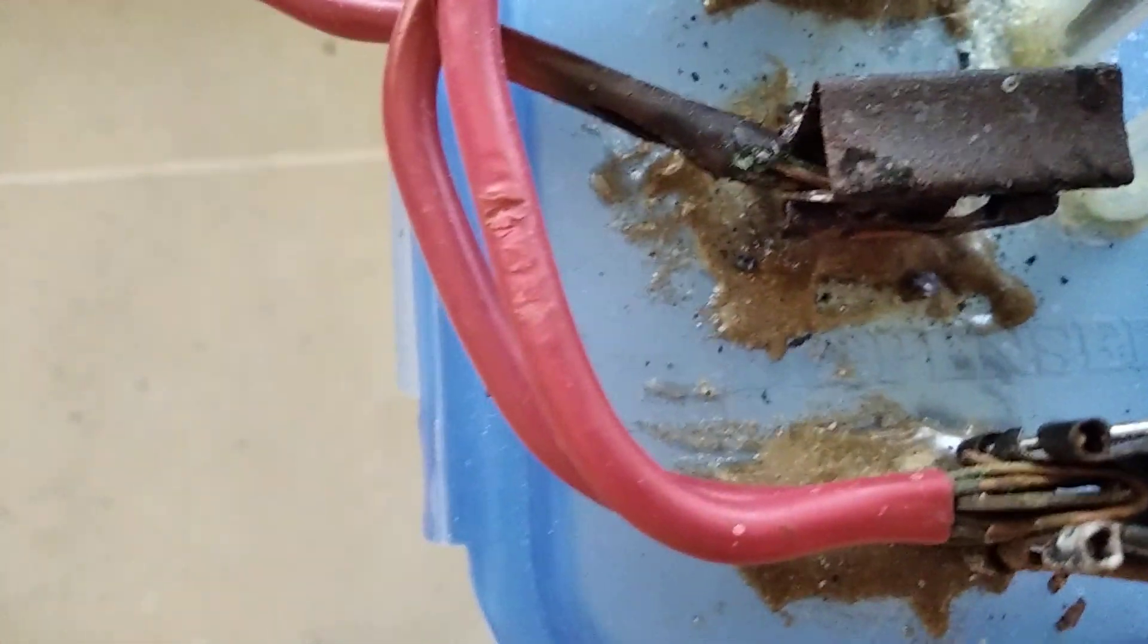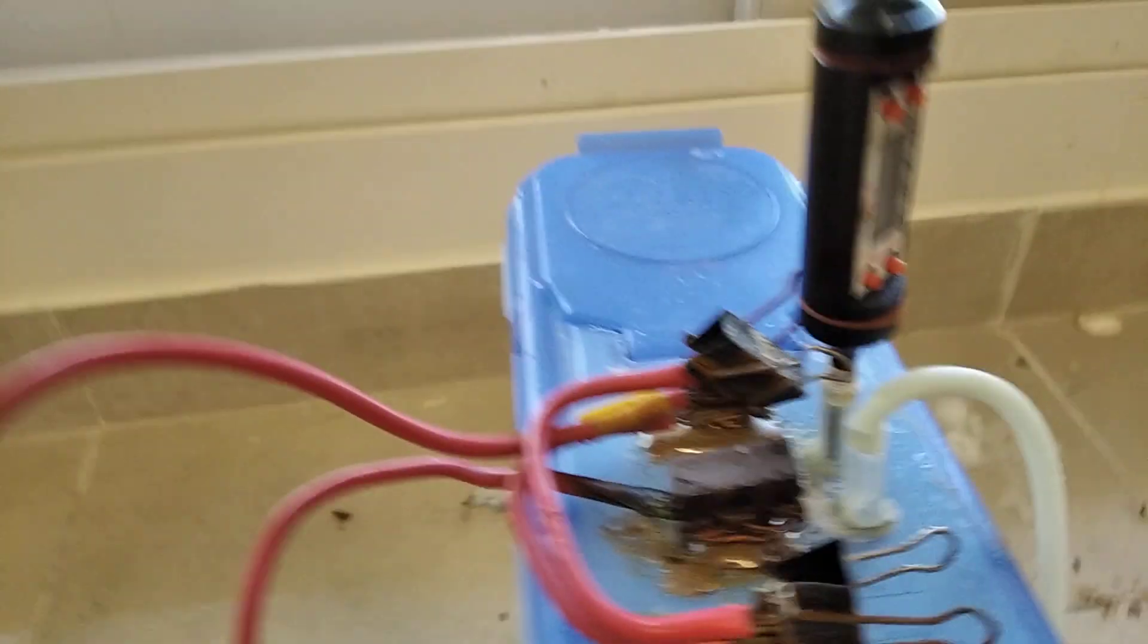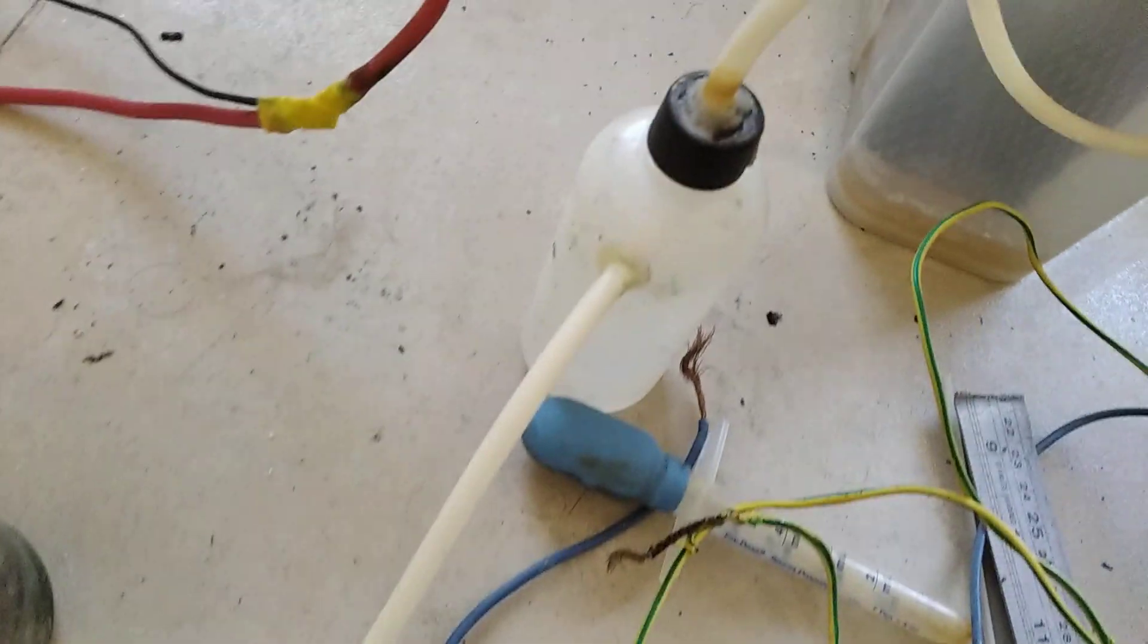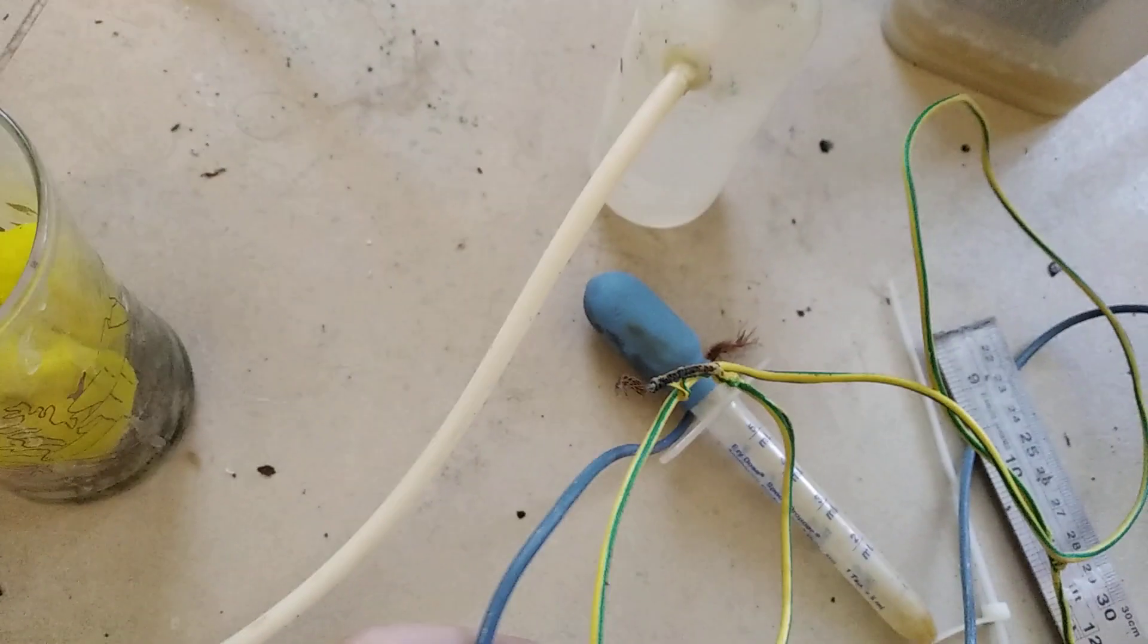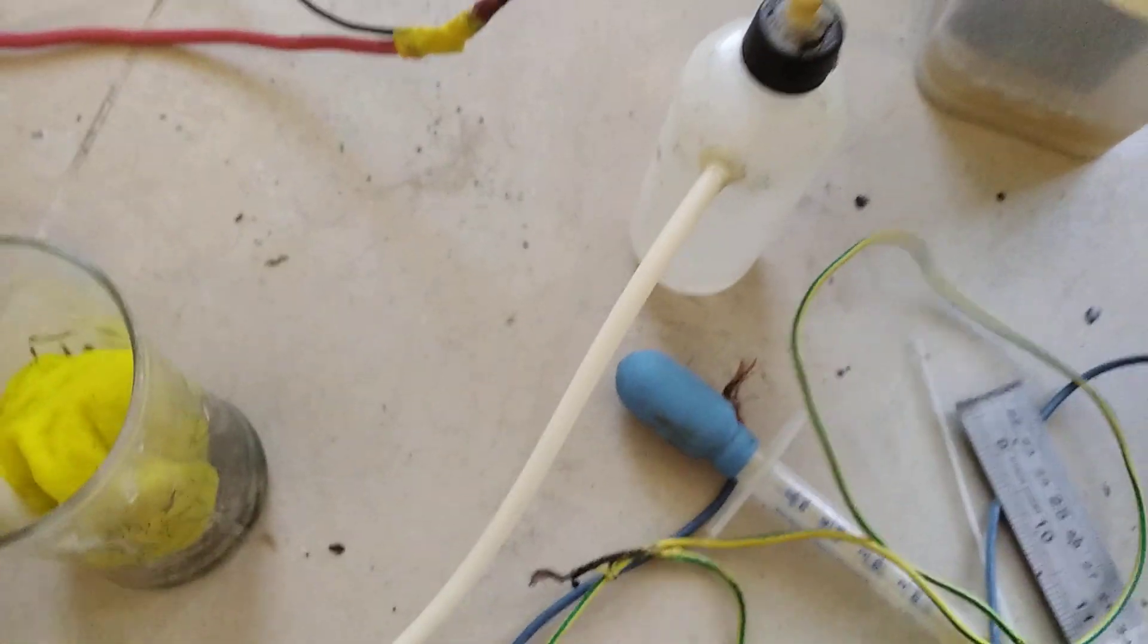And the wires you have to use are these really thick wires that can handle all the current. Otherwise they're going to smoke and melt. Like I just did a test with this wire. I was doing something else. And as you can see that wire is not looking so good.